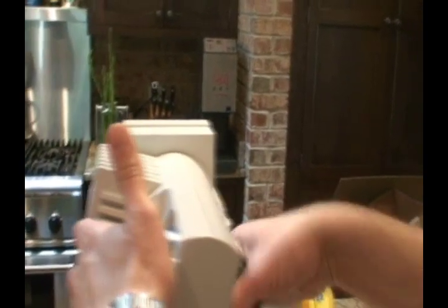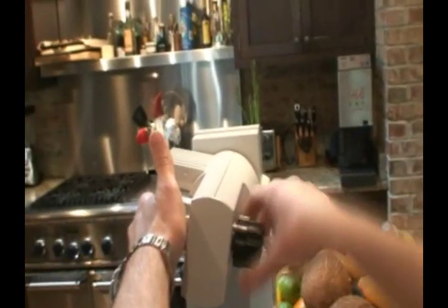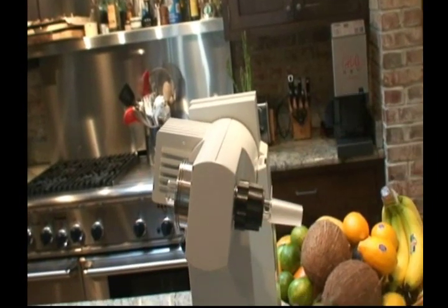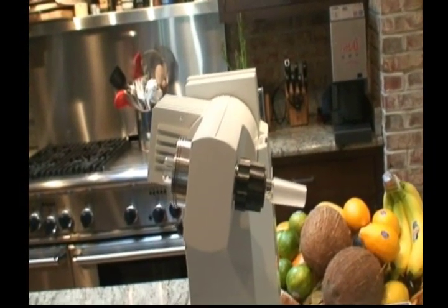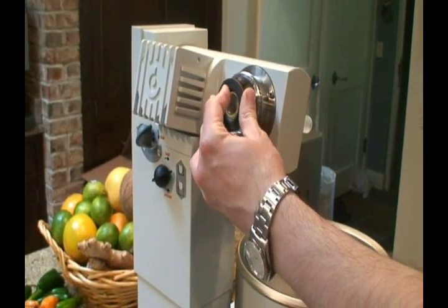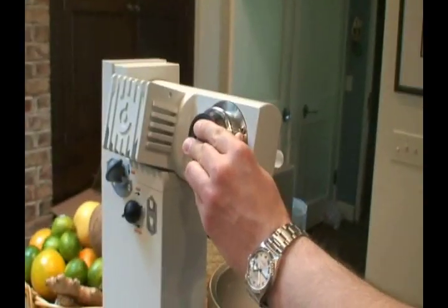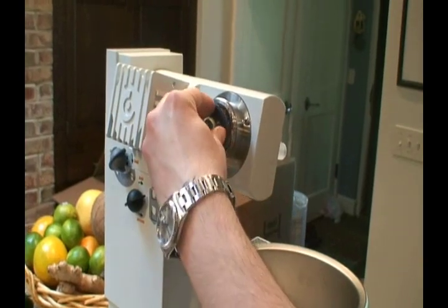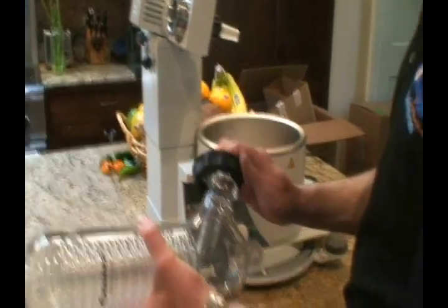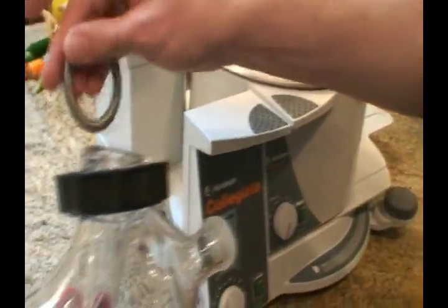The locking button is right up here. Push the locking button and tighten — hand tighten — on the drive. That locking button is right there. That seal is what allows a vacuum-tight seal against the rotating flask and vapor tube. You just slip that on and then slip the spring over.